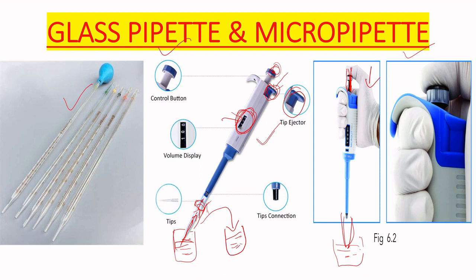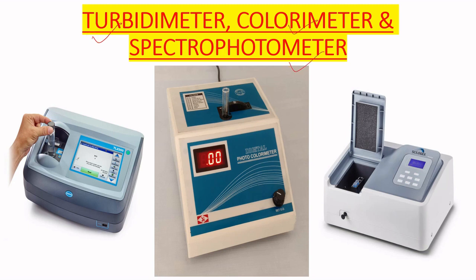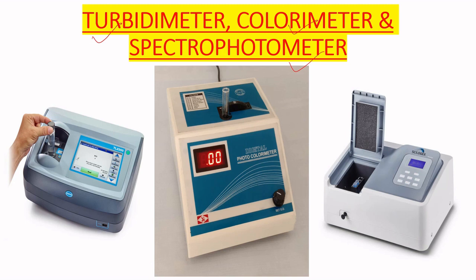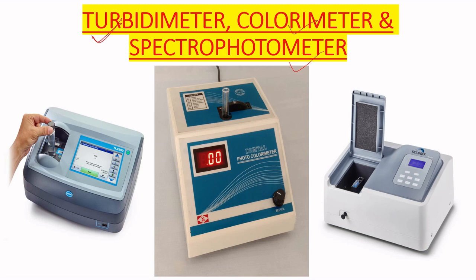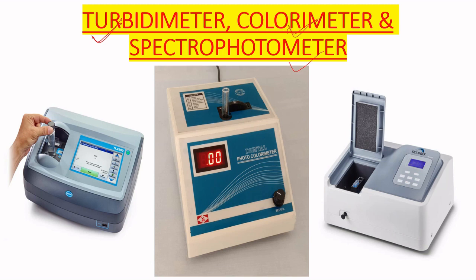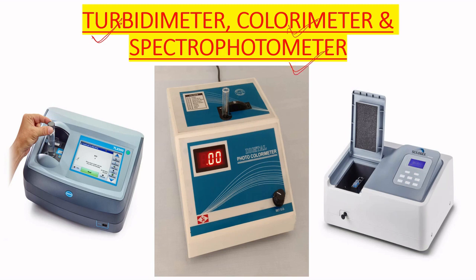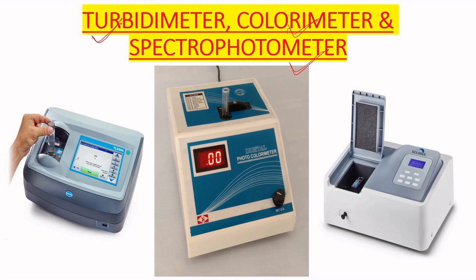The next equipment includes the turbidometer, colorimeter, and spectrophotometer — all used to measure microbial growth in a solution. The turbidometer measures turbidity of the microorganism suspension, the colorimeter measures the color of the solution, and the spectrophotometer measures the OD (optical density) value to determine whether microbial growth is present or not.